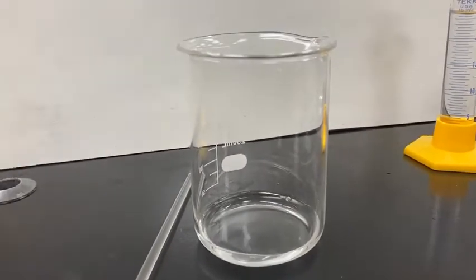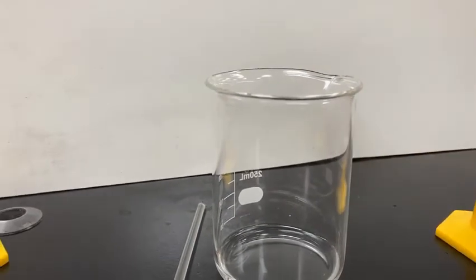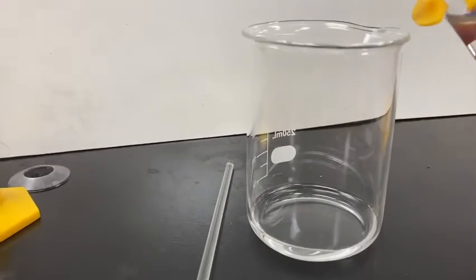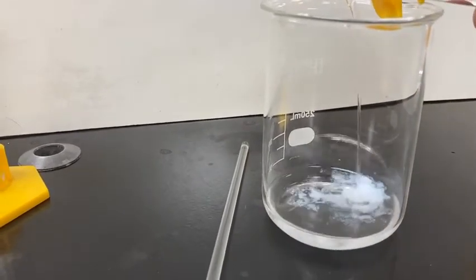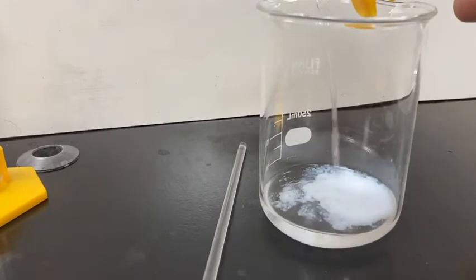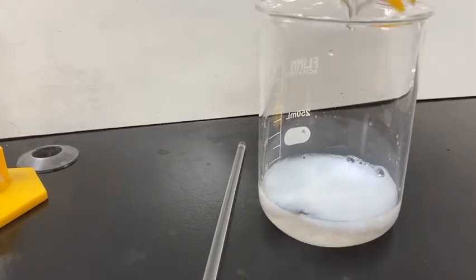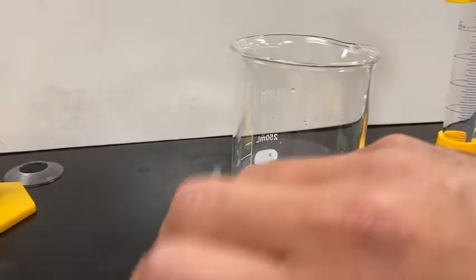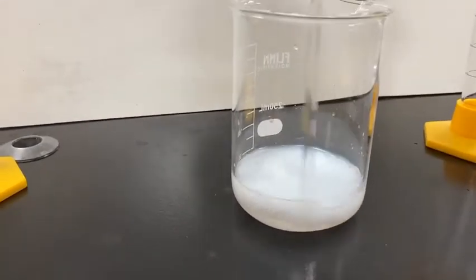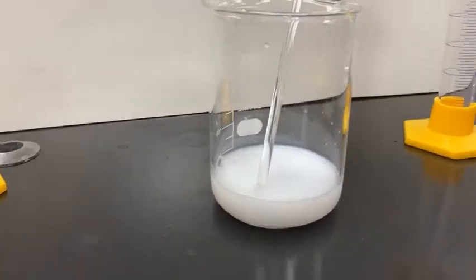There we go. And we're going to take the strontium chloride here, and you will actually see the precipitate form very quickly as it reacts. It's going to be a white, there it is, a white kind of powdery, cloudy precipitate. I'm going to get all of that strontium chloride in. Here I got a glass stir rod that I'm going to use just to mix, get things colliding in there. I'll leave that in there for a second.